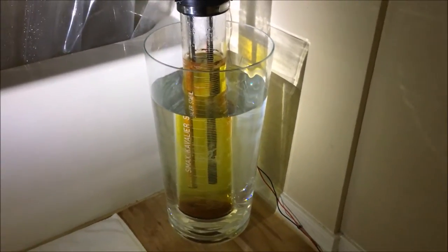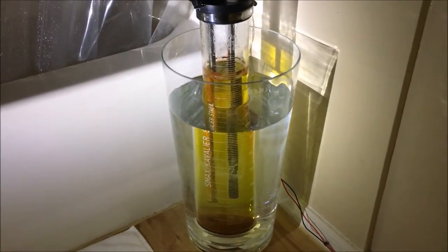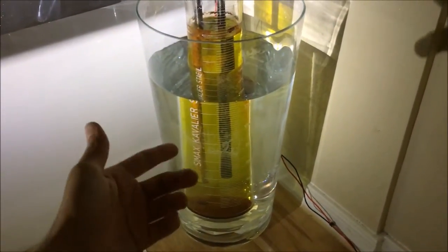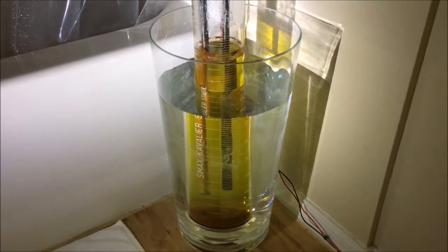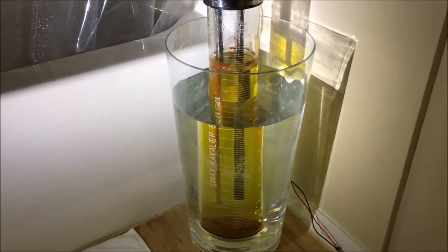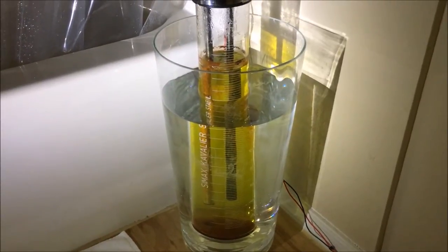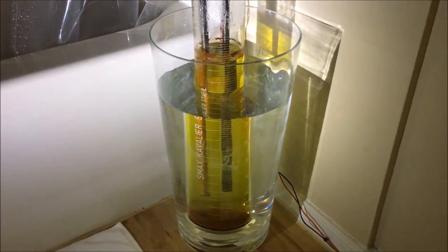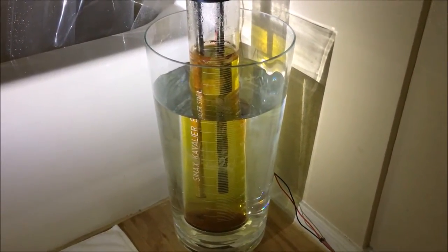Now, here's the second problem that I've run into, and this is more of a logistical problem. Stainless steel contains chromium, and this oxide and this yellowish solution that has formed is going to be very rich in hexavalent chromium. Hexavalent chromium, which is a 6-electron deficient cation of chromium, is quite toxic. It's highly genotoxic, which means it's a carcinogen, and it's also a very serious environmental threat if you pour it down the drain or end up putting it in a landfill.